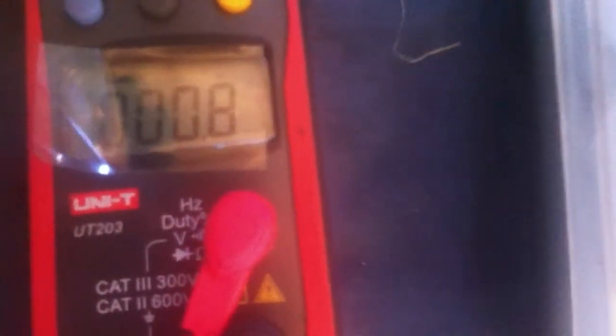Back with the ground up charcoal. It looks like the mothballs did something with the charcoal. Holding at 0.8 — that's better than the sugar and the bread. They were on top, so I guess all the fumes would have went up through the charcoal. I just crushed up a big chunk of it, so I don't think it's just on the outside — because it would be blended with the center charcoal.